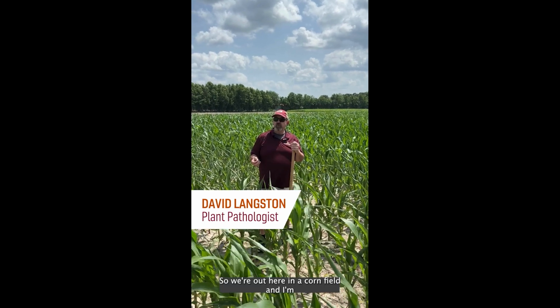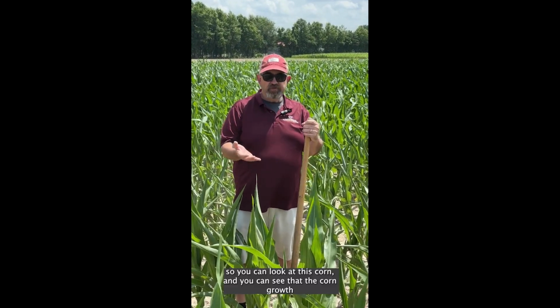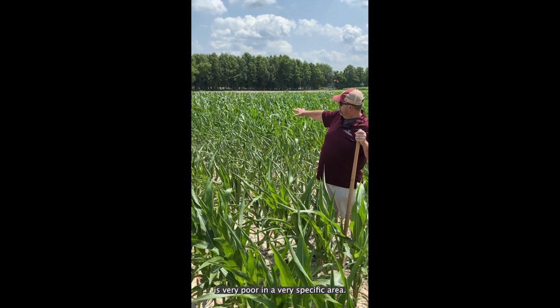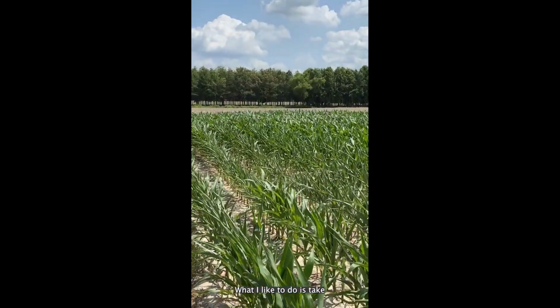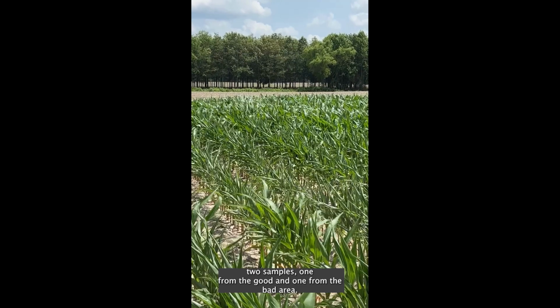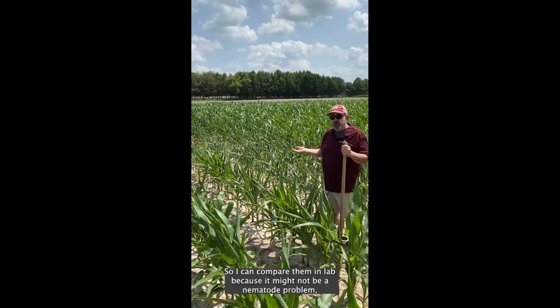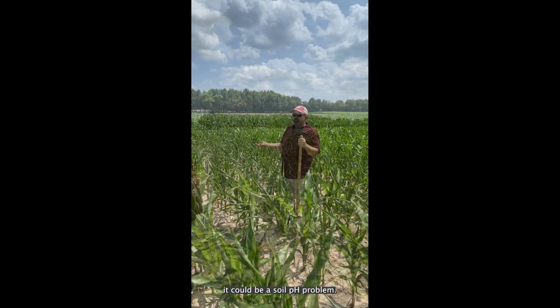So we're out here in a cornfield, and I'm going to demonstrate taking a diagnostic nematode sample. You can look at this corn and you can see that the corn growth is very poor in a very specific area. What I like to do is take two samples, one from the good and one from the bad area, so I can compare them in the lab, because it might not be a nematode problem. It could be a soil pH problem.